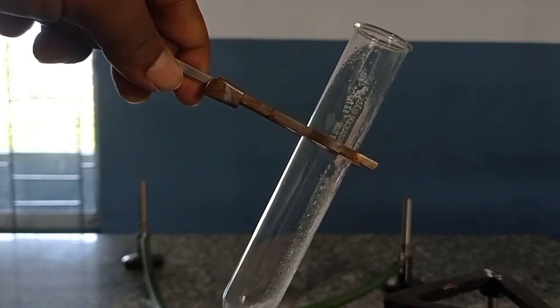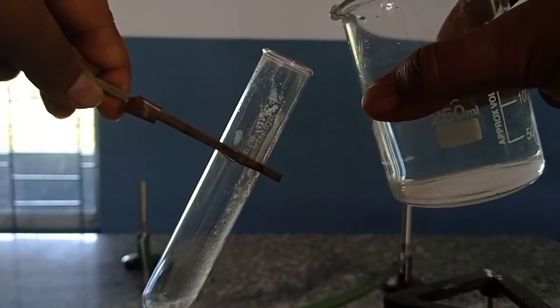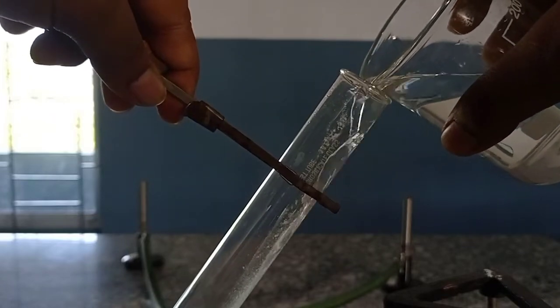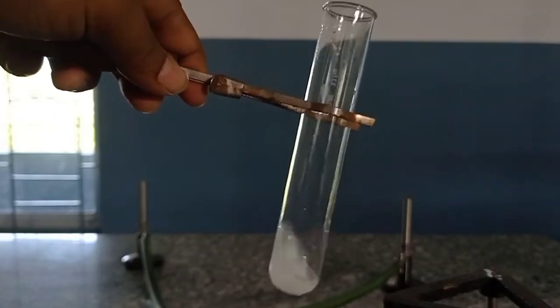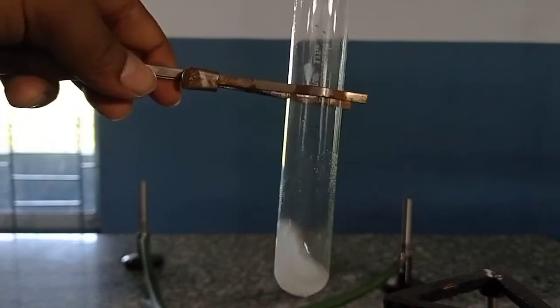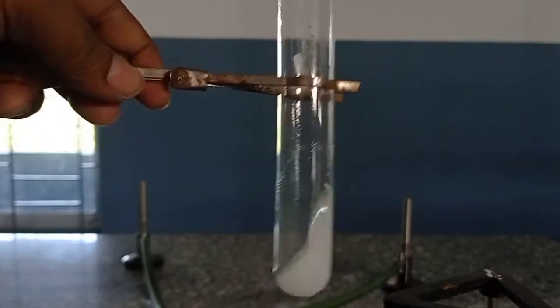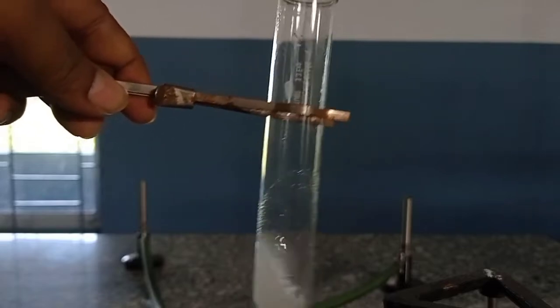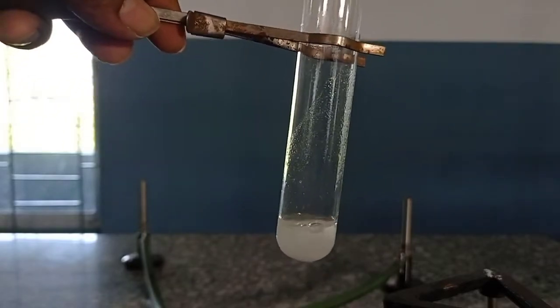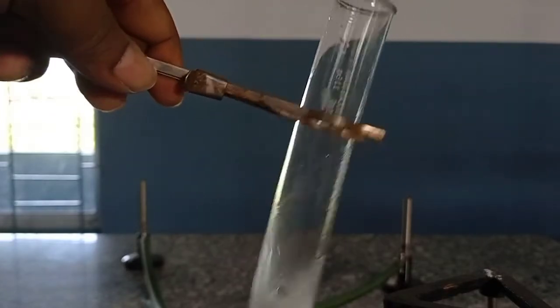After adding the sodium bicarbonate, I will add a little amount of distilled water into it and try to prepare a solution of this salt, because in the solution state the reaction will be faster. So I have prepared a solution of sodium bicarbonate here.